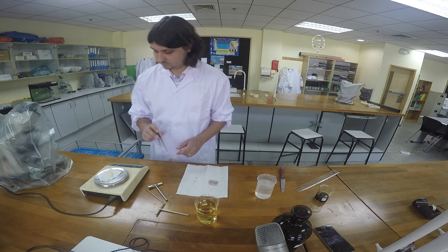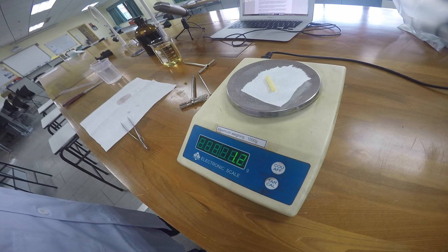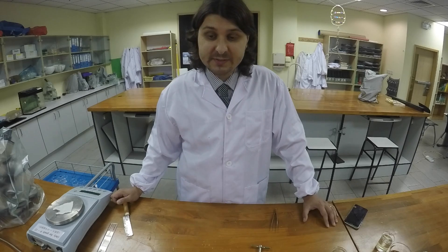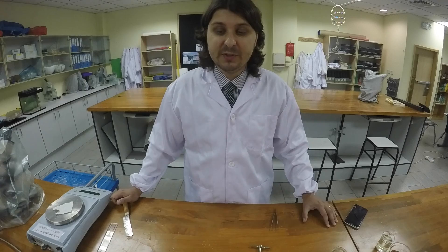You are now able to calculate the percentage change in mass of your potato cylinder. As you noticed, the change in mass is quite small but represents a large percentage of the mass of the cylinder. For this reason, it's important to be careful about every measurement done in this experiment.